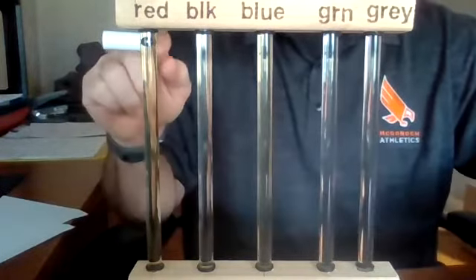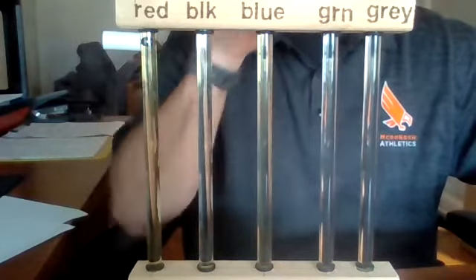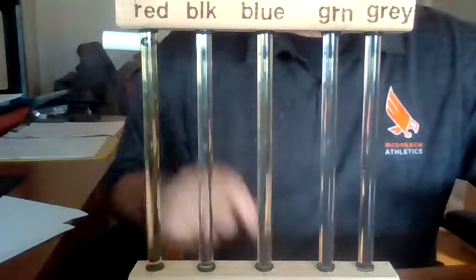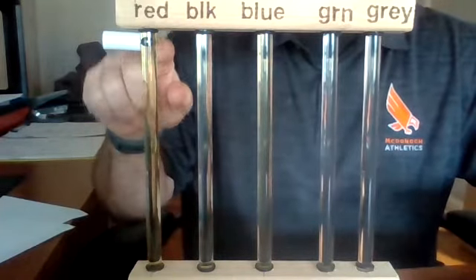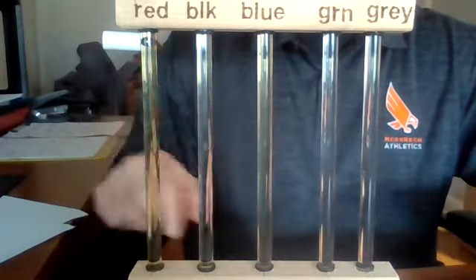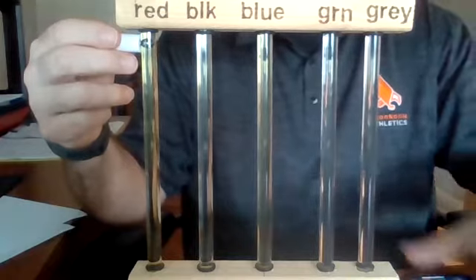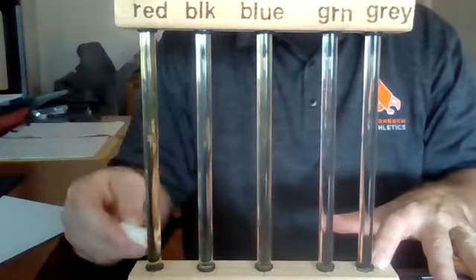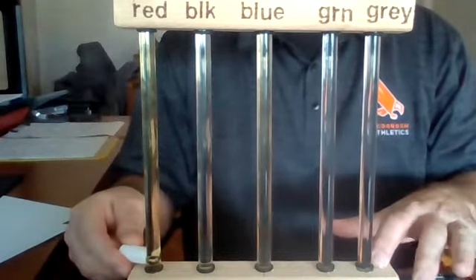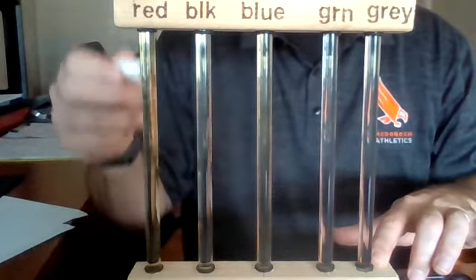So we're going to start with the red tube, and in the red tube there is a steel marble that we're going to be measuring the time it takes for it to travel the distance of our tube. I have a magnet here that will catch it each time. All right, so here comes trial 1. And our number is 1.7 seconds. Let's go ahead and reset.